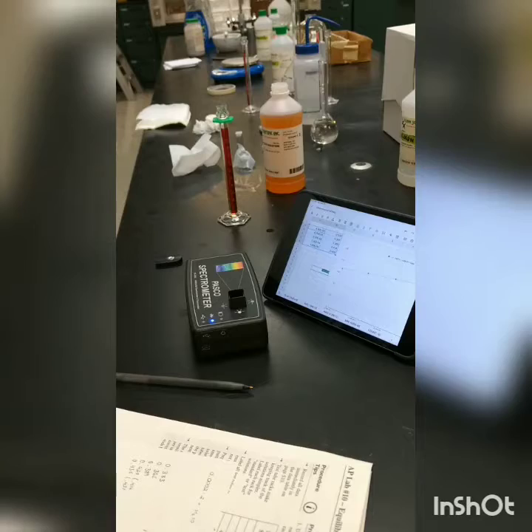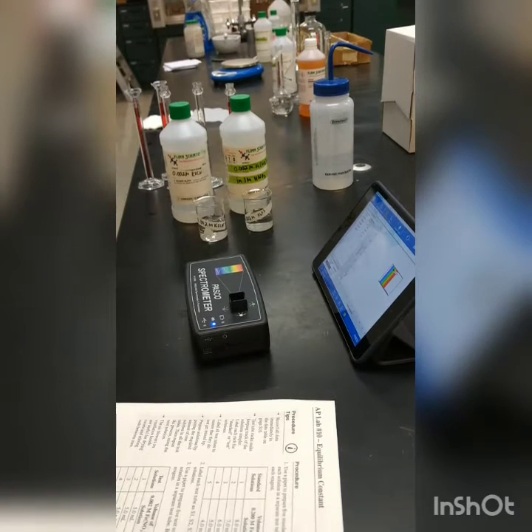All right, so in part 2 of the lab, the biggest difference is that we're going to be changing up the concentrations. So you can see there I've got 2 bottles. These are both 0.002 molar. At this point, we're not using Le Chatelier's principle to influence where equilibrium lies. In the first part, we were driving equilibrium to the right by using a huge excess of iron ion. Now we're not trying to do that. We actually want to know what the equilibrium constant is for this reaction.